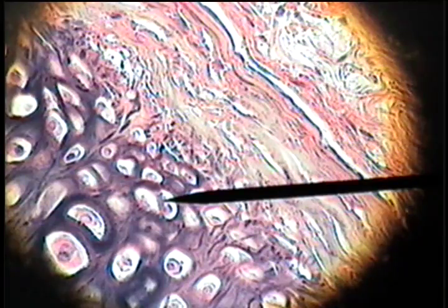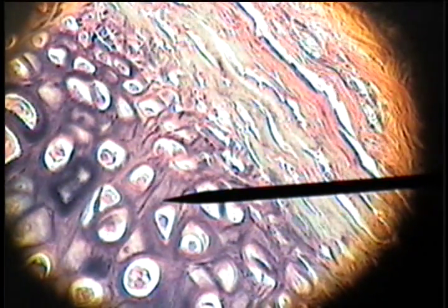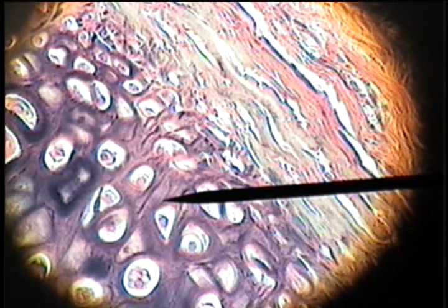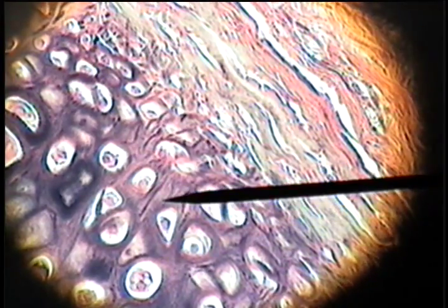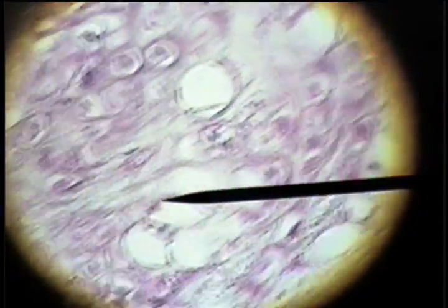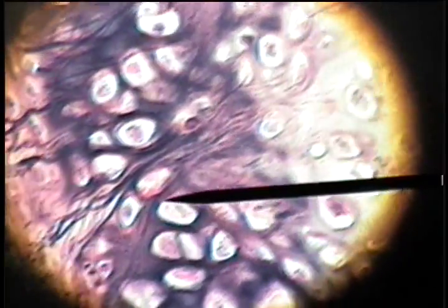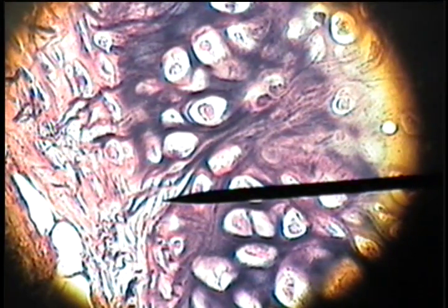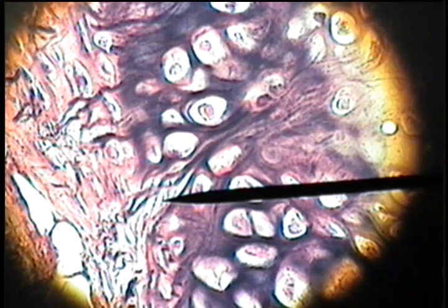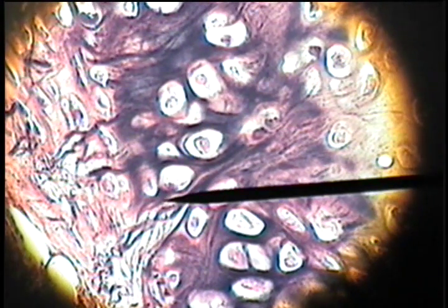Here are two chondrocytes in a lacuna, and then in the matrix of the connective tissue, we see these large elastic fibers characteristic of elastic cartilage. Here they are again on the opposite side — these are the basophilic fibers of elastic cartilage.